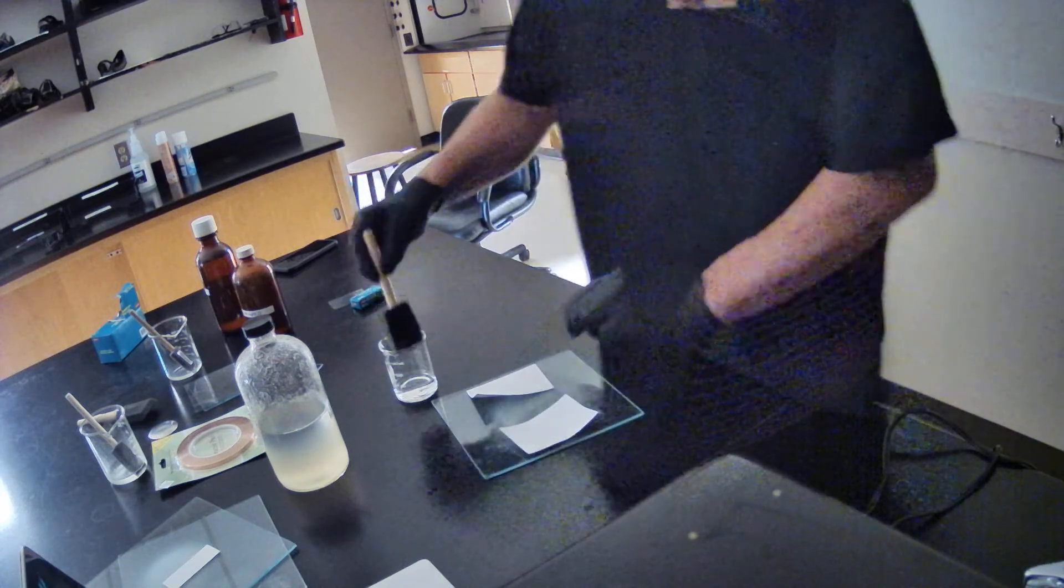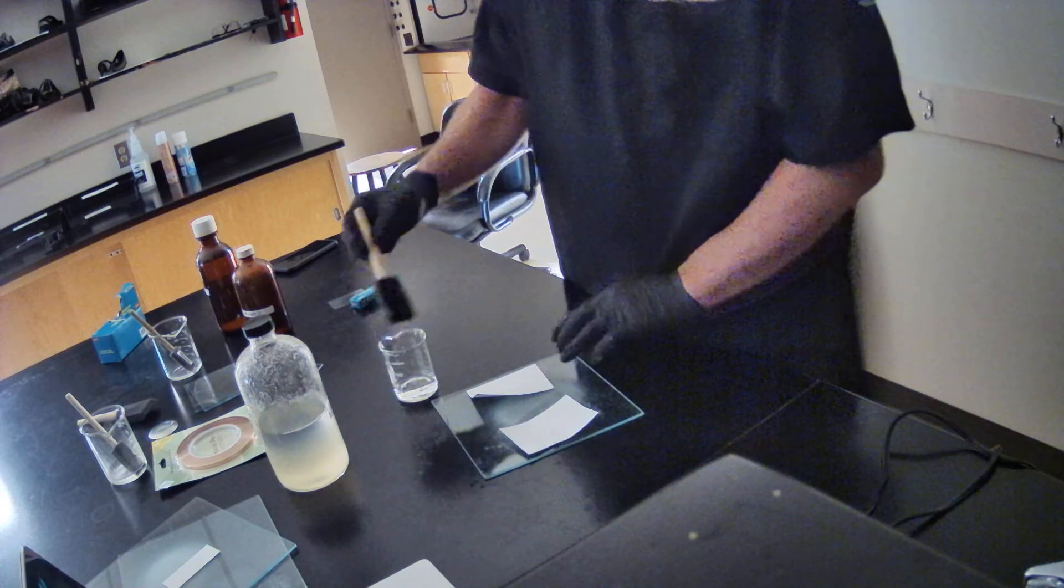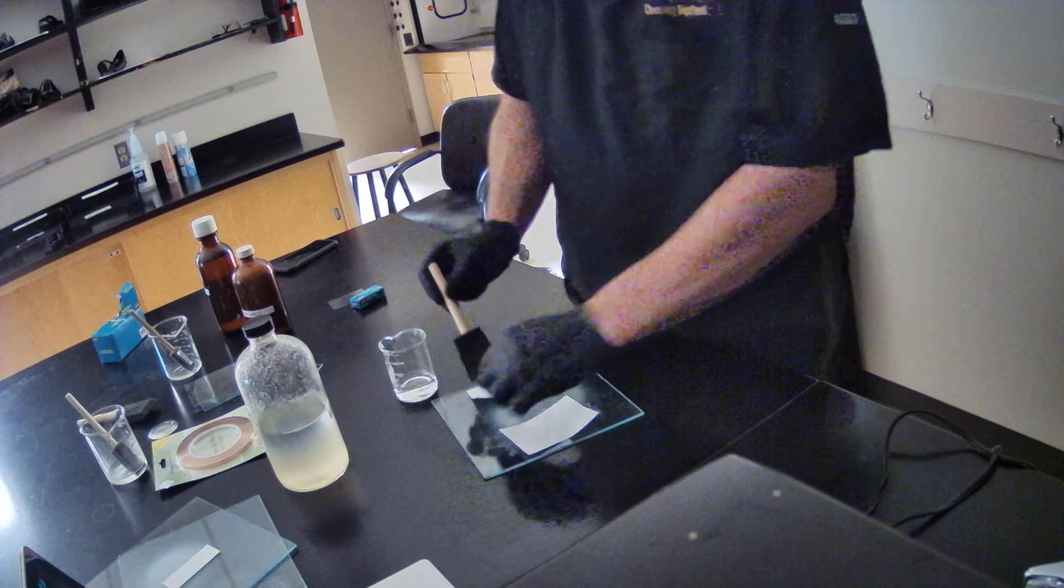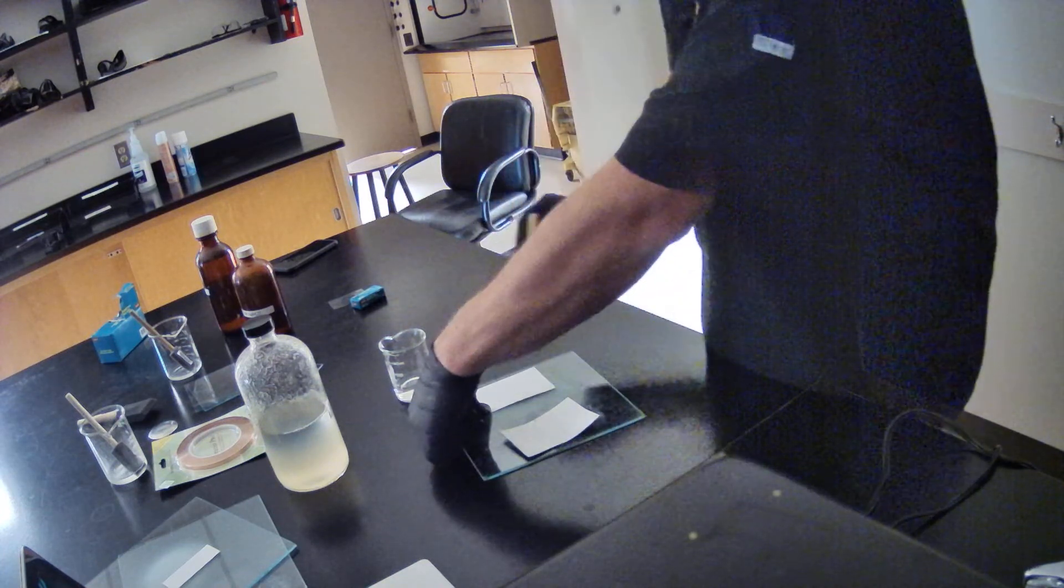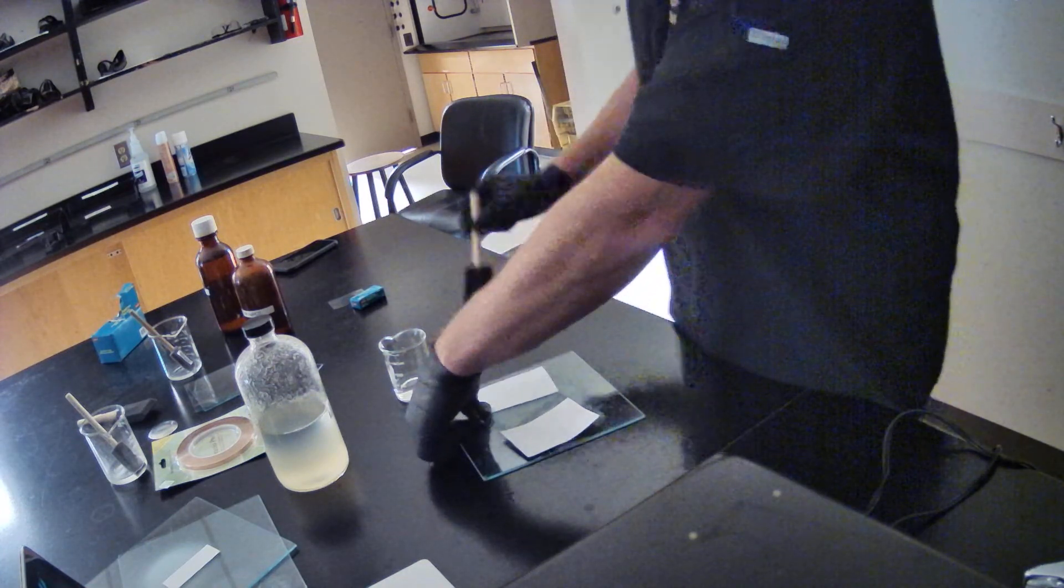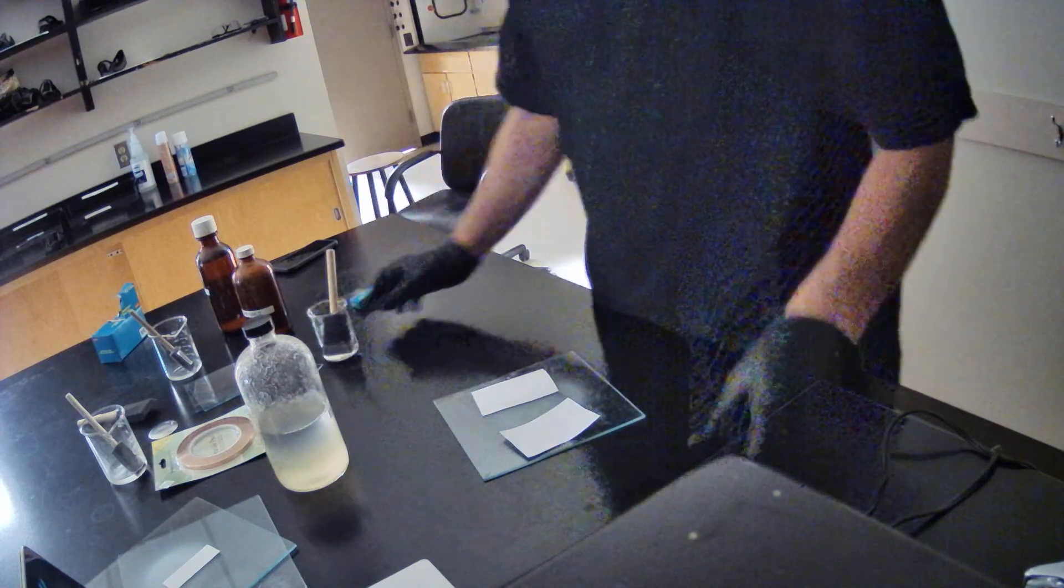I'm going to put that on both sheets of paper here. And then we're ready to dry again.